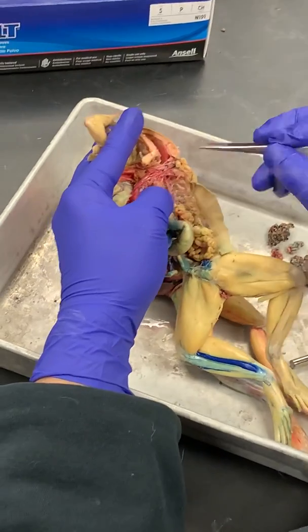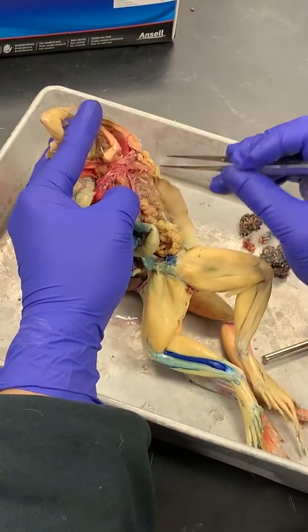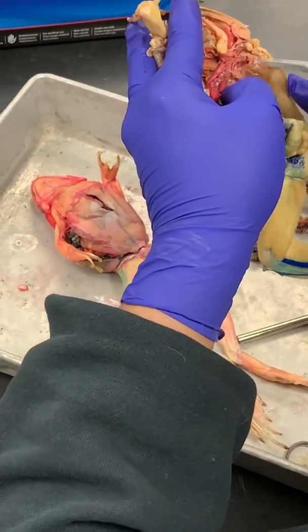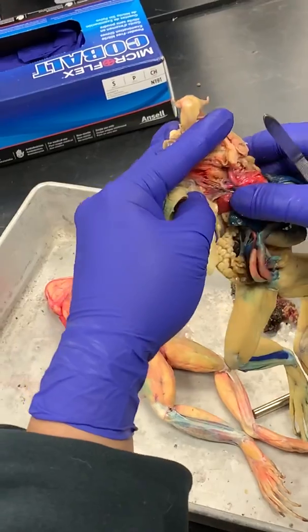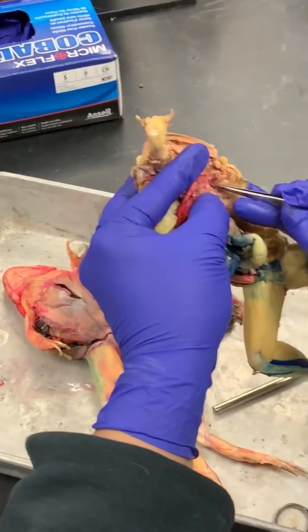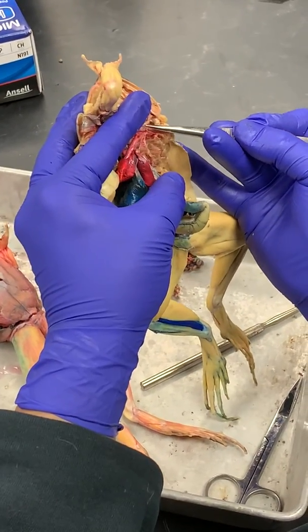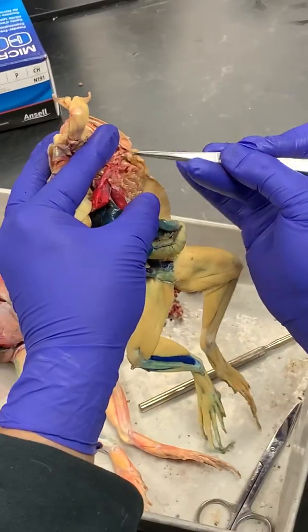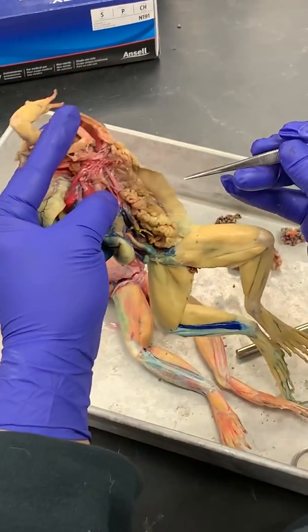All right, so this is a subclavian artery. The subclavian comes off the systemic arch. Okay, so I can see there's one on this side. If you just follow it, it goes into the arm. Okay? So it's going to dive deeper here than this cutaneous artery that goes up further. It's more anterior. Okay, so you guys have that.